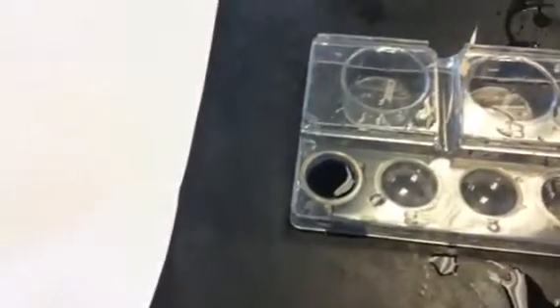We're going to go, there's our 15 drops of water and one drop of food coloring. And you can kind of see as I swirl that around, that's what it looks like. So you can write down your observations, decide whether that's chemical or physical.